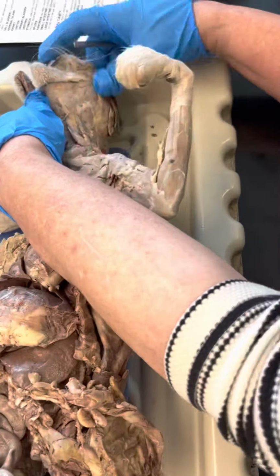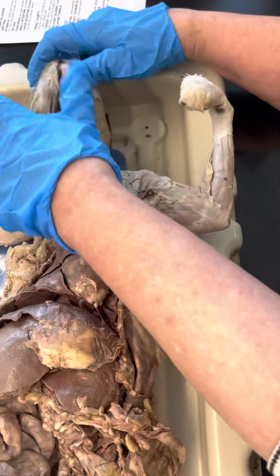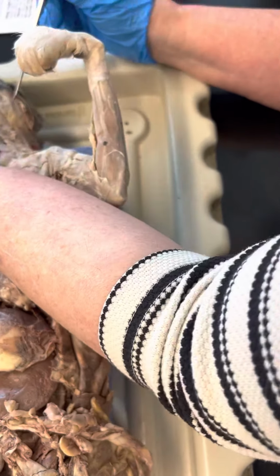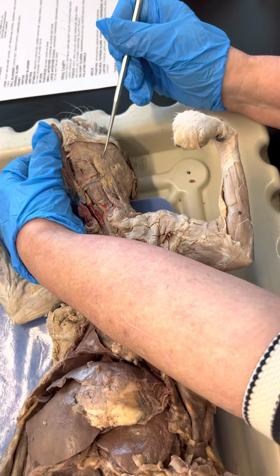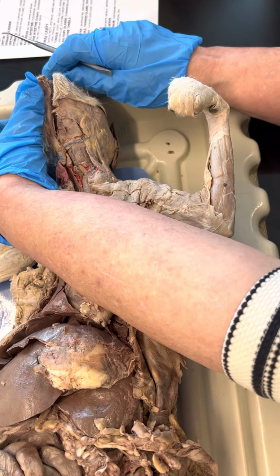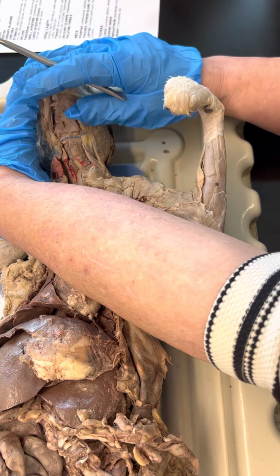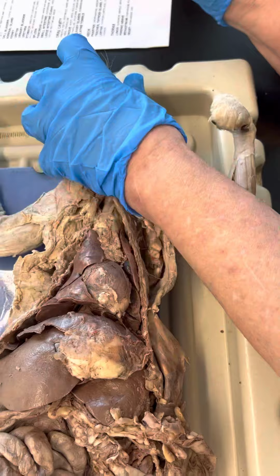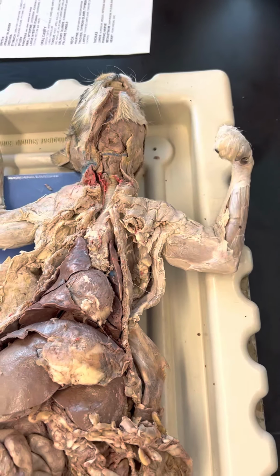Let's see what we got here. They're a little tricky. This one's not real good. But your parotid gland would be your easiest one to get. It's right here. Your submandibular, they don't have it out here good, but it would be down in here. I have not seen a sublingual on any of these. Have you? No. I think that sublingual is super hard on the cat, and I doubt that they would even pull it. Palatine tonsils, I can't see them, but they would be at the back of the palate.